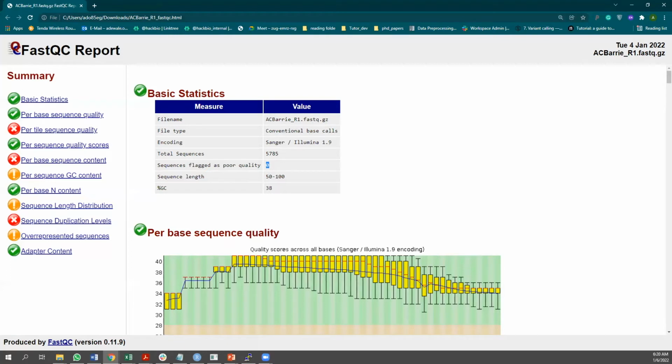As you can see, the report contains one result section for each FastQC module. In addition to the graphical and tabular data provided by each module, a flag of pass, warn, or fail. This is pass, this is warn, and this is fail. Okay, the red is the fail, the yellow and orange is the warning, and the green is the pass.